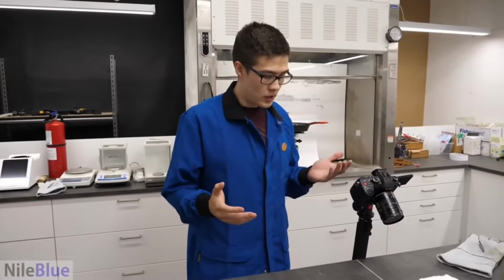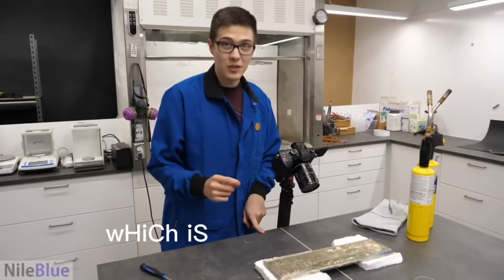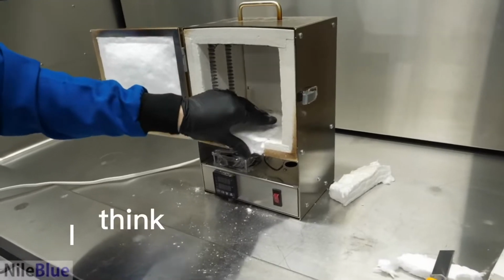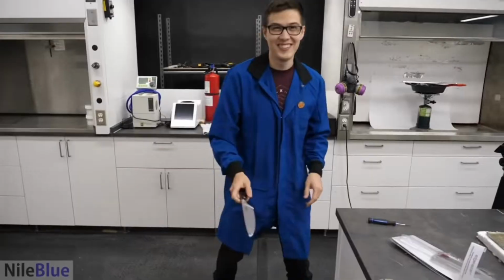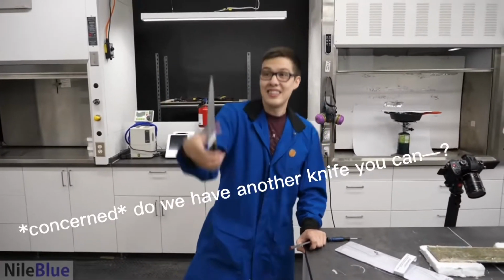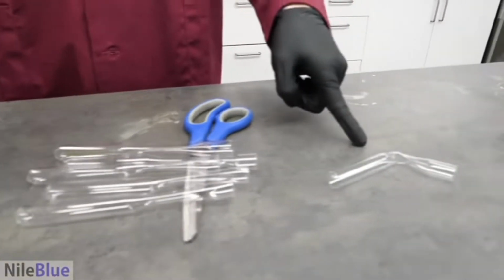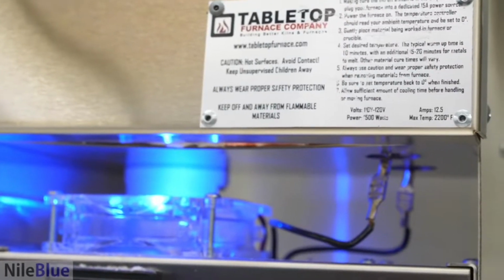What you have to do is carve out the knife from this, which is still hot. I think this will be okay. Okay. Do I risk it? Do we have another knife? You can. Oh, I did it. Chances. And this one. So far, the oven has survived.